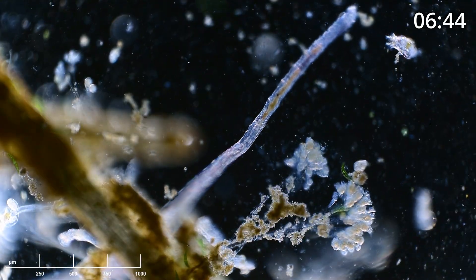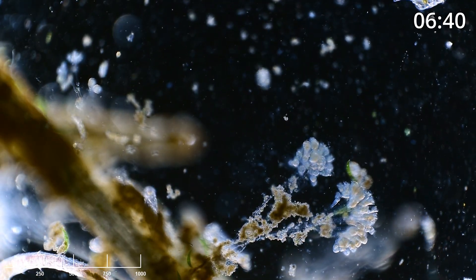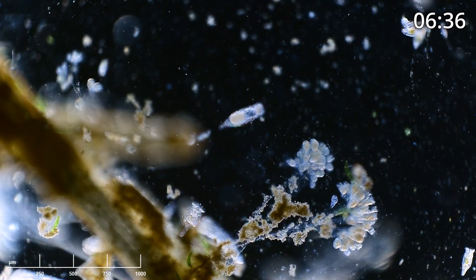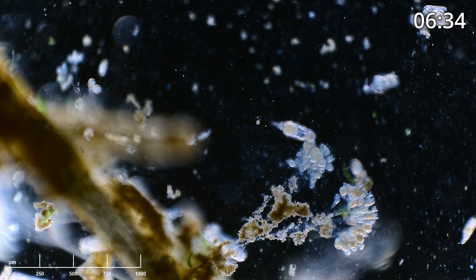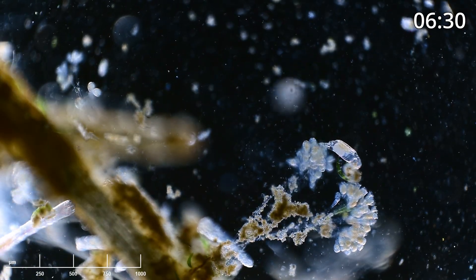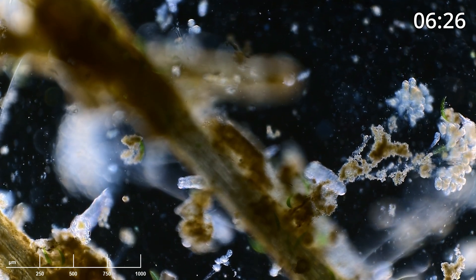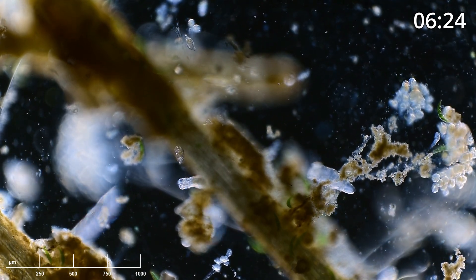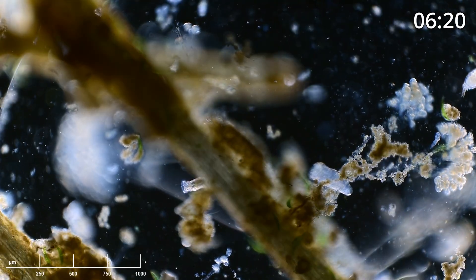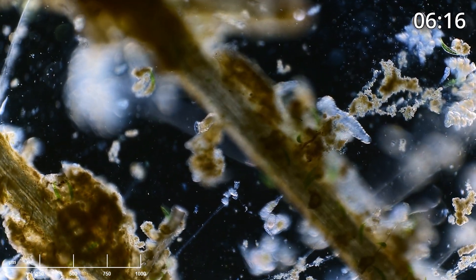That's obviously a very large worm. I'm not an expert on worms, and these worms tend to really destroy a lot of the other organisms in the sample, both by eating them and just by crashing into them. What else do we see here? A lot more rotifers — big rotifers, small rotifers. I saw a tiny one just fly off the top of the screen.